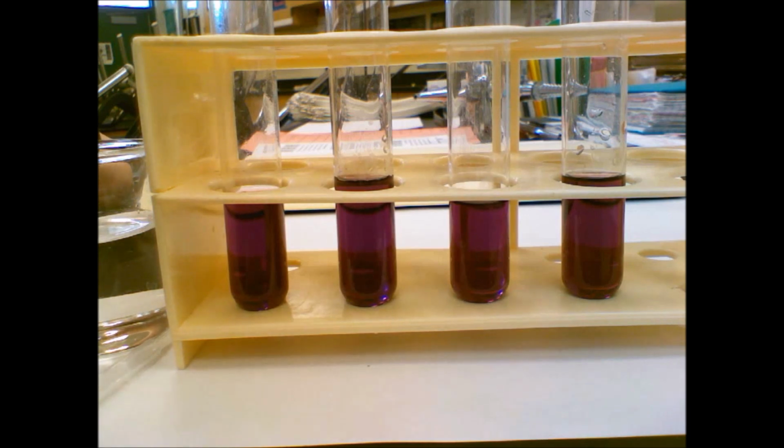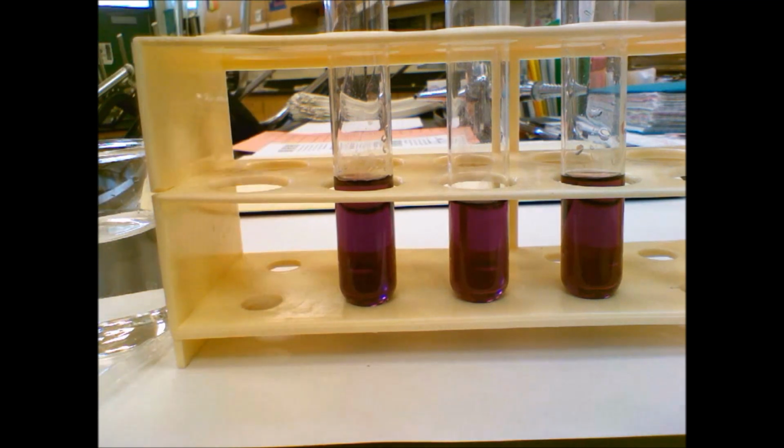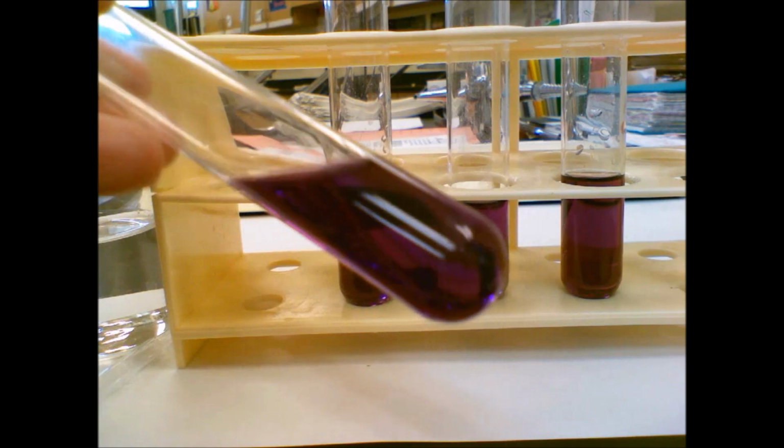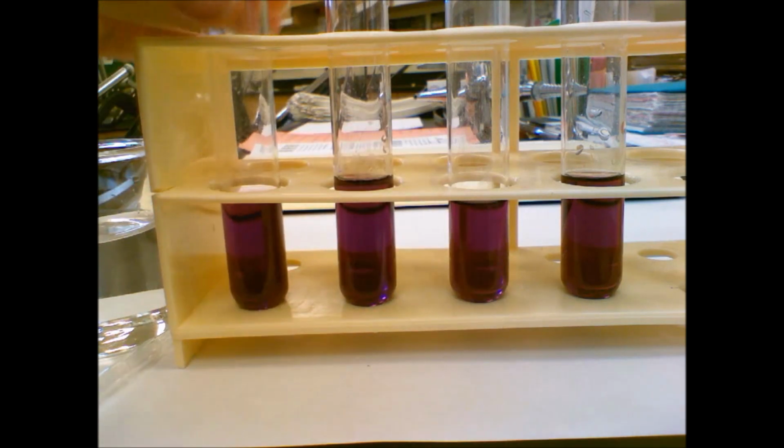More reactants equals pink. If there are more products than reactants, then the solution will be blue. So more products equals blue. If there are equal concentrations of reactants and products, the solution will be purple. So we've designed this reaction so that we have equal amounts of reactant and product. You can see our purple, kind of magenta, it's not super magenta, but purpley colored solution.